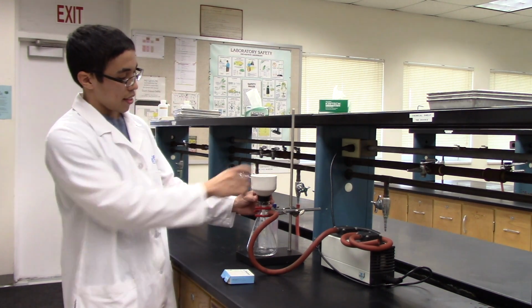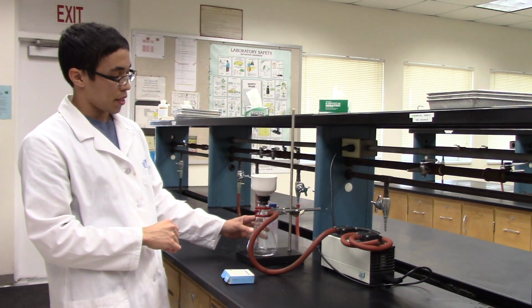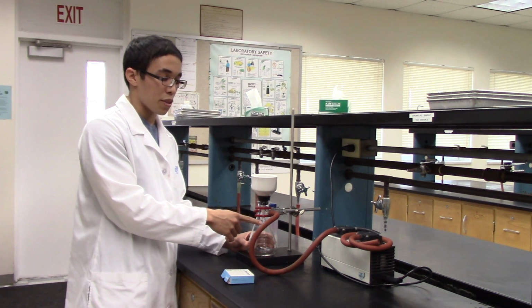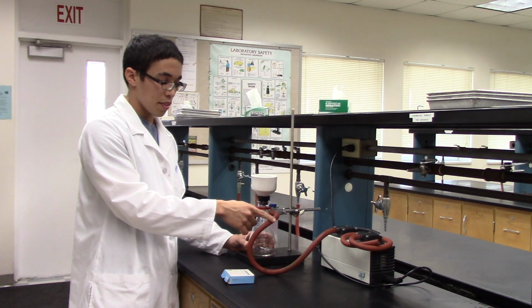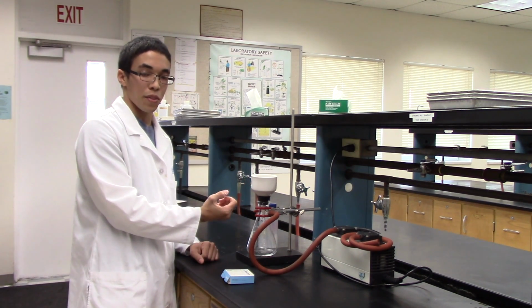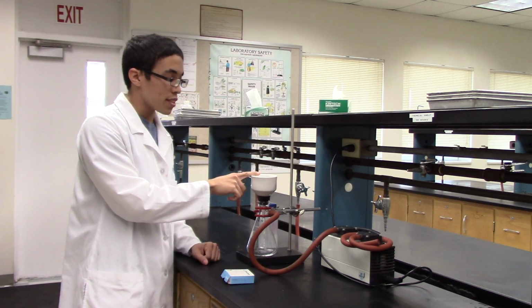Remember, all of this depends on a good seal. Vacuum filtration works by creating negative pressure in the filtration flask using a vacuum, and then using that negative pressure to pull contents through, in this case the solvent, but leaving the solid on top. You will then take this solid and weigh it at the end of class and label it in a weigh boat.